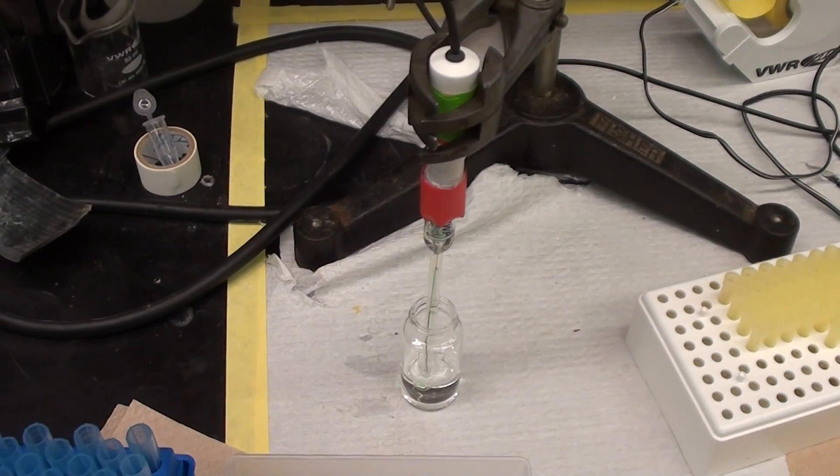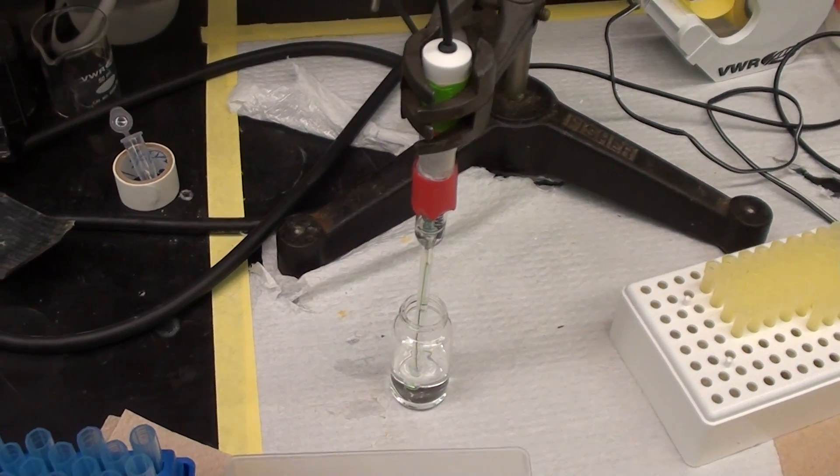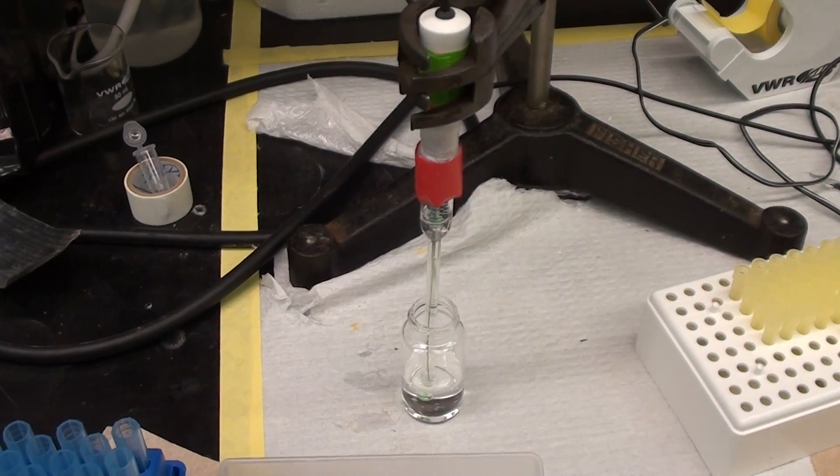Now it may simply need some maintenance like a refilling or a cleaning, and you should consult your electrode manual on the procedure.